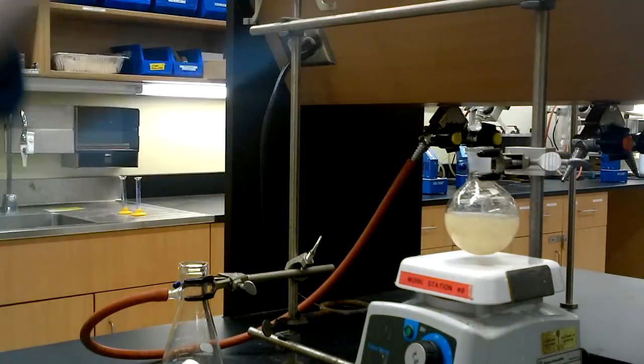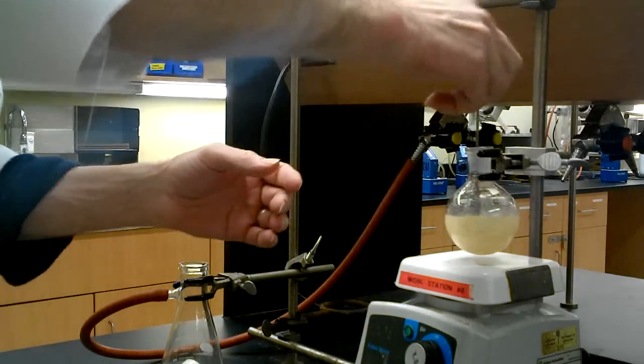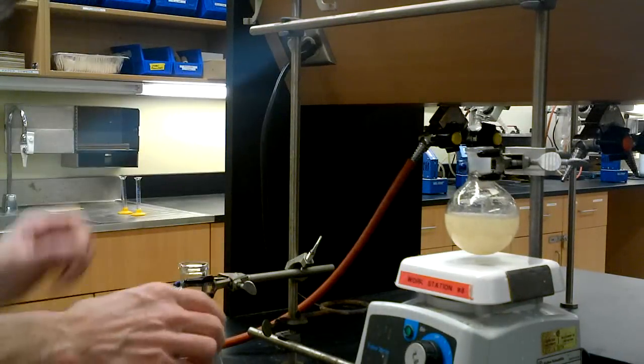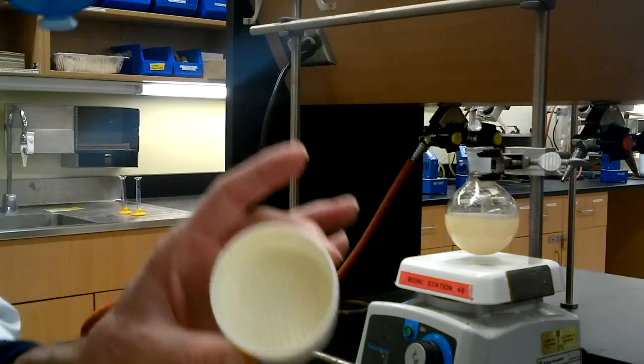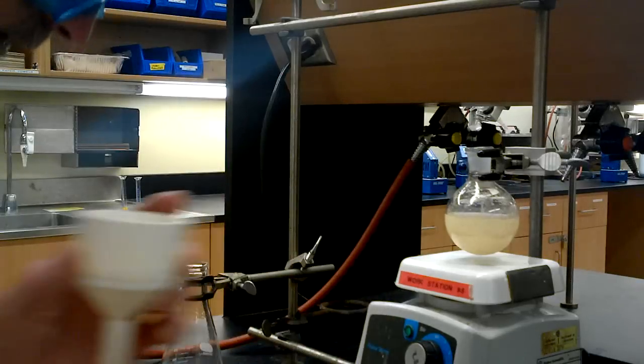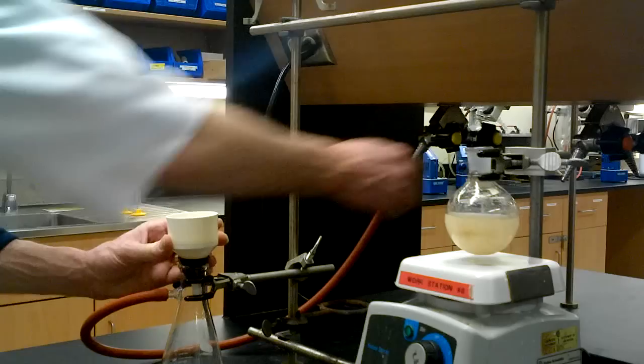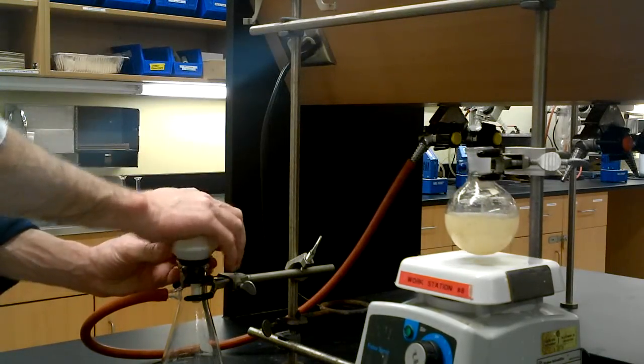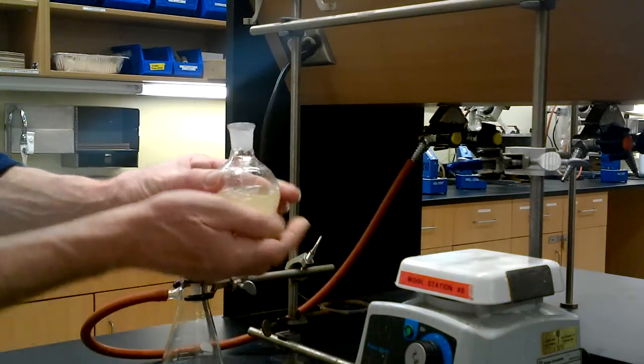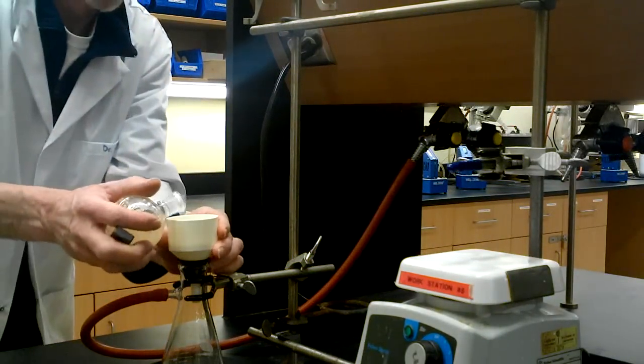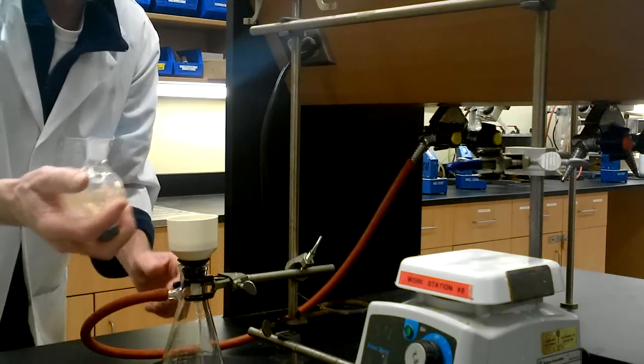Had to stir this for a while to get the lumps all broken up. I used my spatula to get the compound off the walls, and now I'm ready for my filtration. I have my suction flask clamped and the hose ready. I have my Buchner funnel with the holes, the holes covered up with filter paper, the neoprene adapter in place, and ready to go. A little bit of vacuum, I can hear it working. And I can ever so quickly pick up my flask, swirl, swirl, swirl, and in we pour.